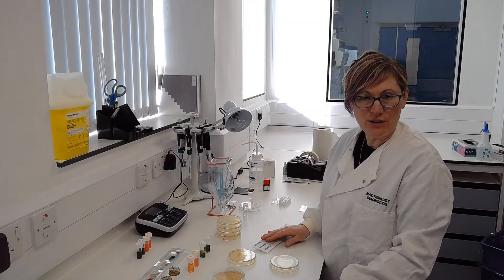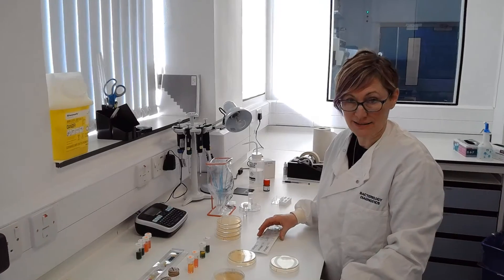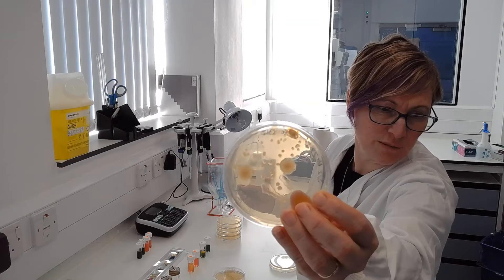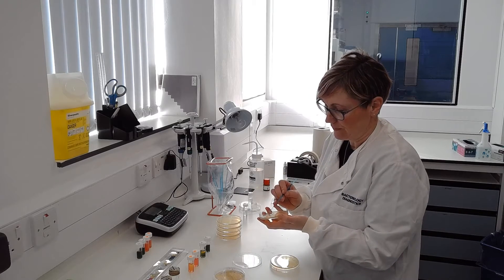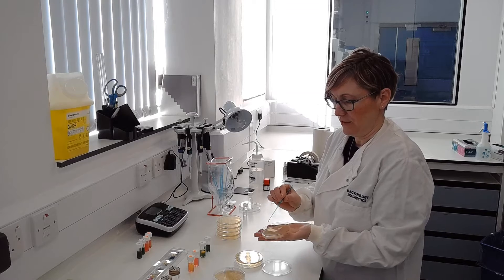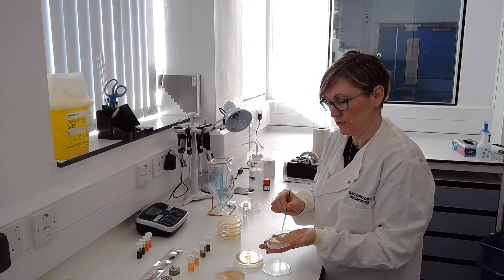The first thing that we always do with our samples and the colonies that we're interested in is make sure that they're pure and we're only working on one bacteria at a time. I will pick one colony from that population and streak it out onto a new plate where it can grow. We take a very small amount on a sterile loop and spread it on the agar plate, then turning the plate and the loop, work our way round, almost diluting the culture until we have a good pattern of growth.